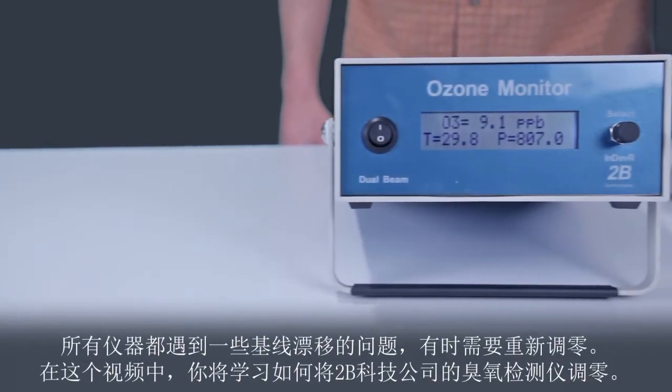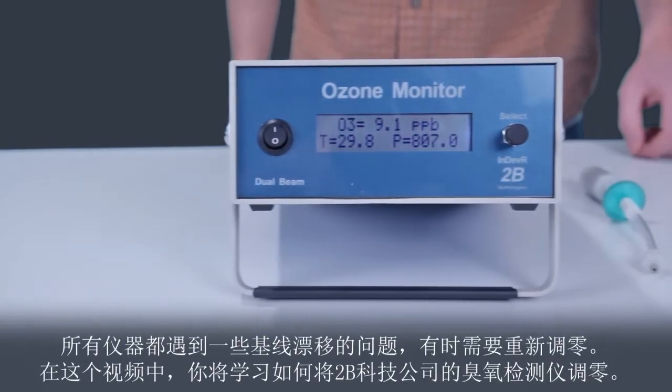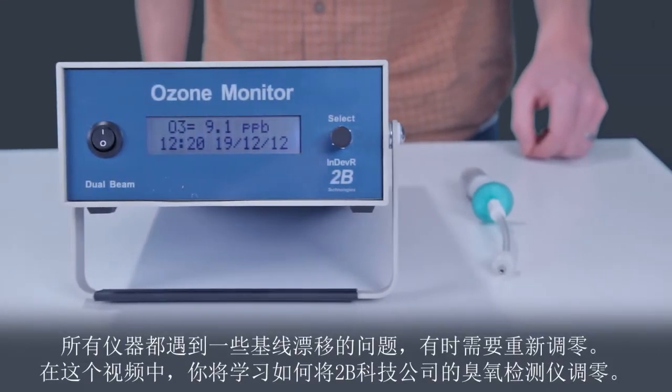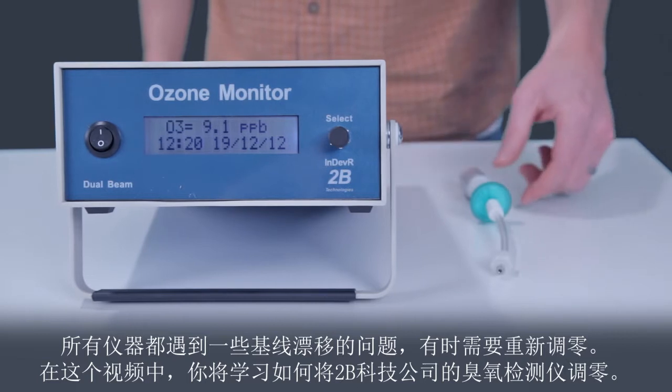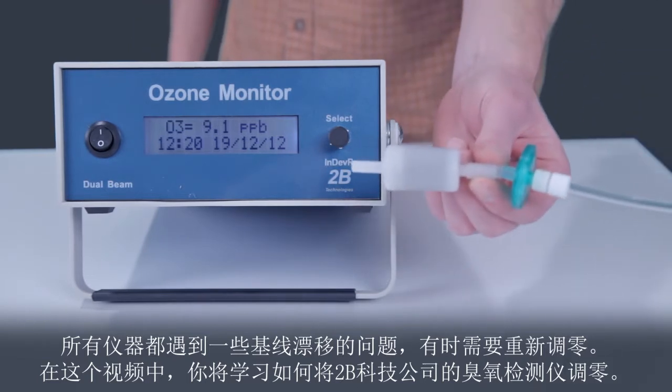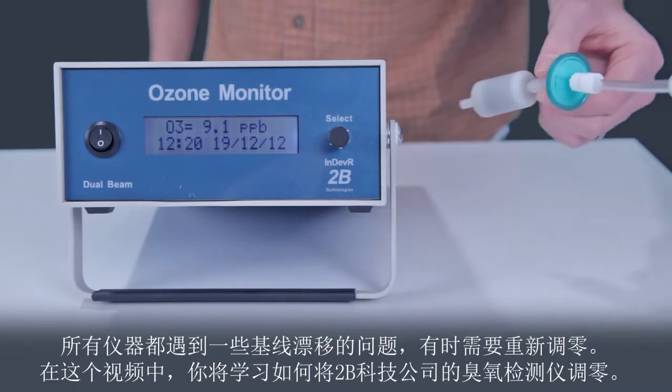All instruments experience some baseline drift and need to be re-zeroed from time to time. In this video, you will learn how to re-zero your 2BTech ozone monitor.